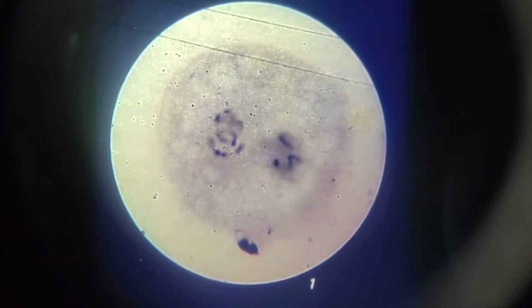The chromosomes are not seen distinctly because they are very thin. This cell is thick and round like a tiny ball, making it difficult to keep all the chromatin in focus.